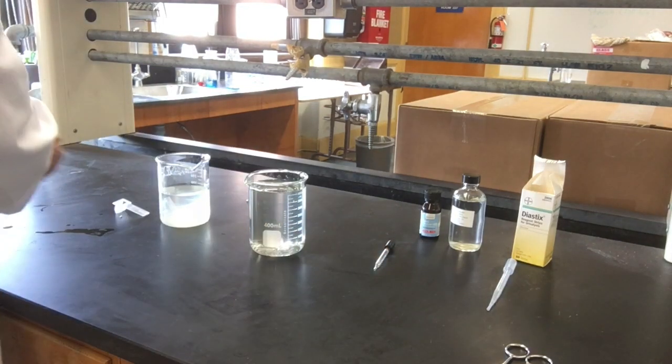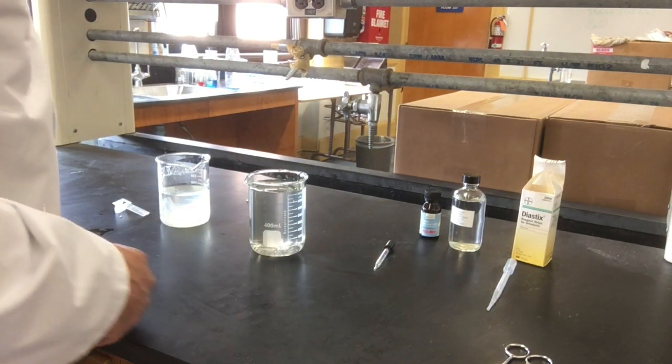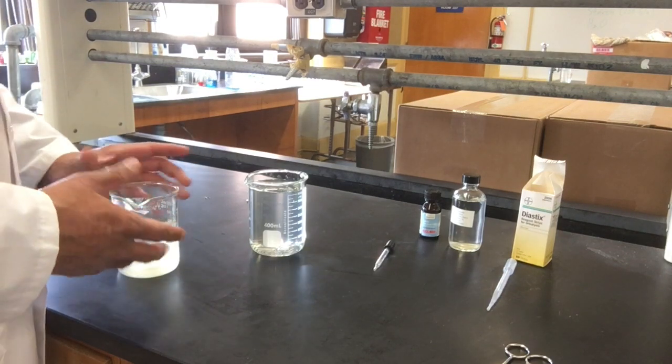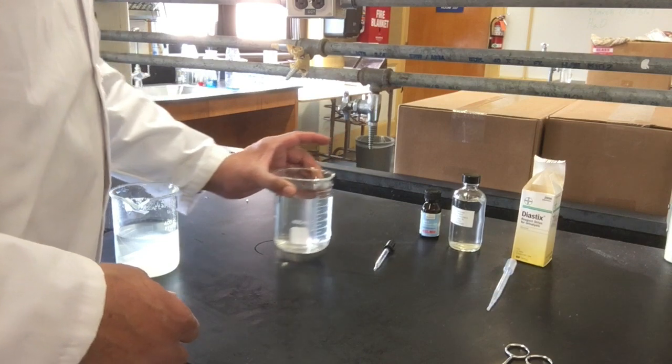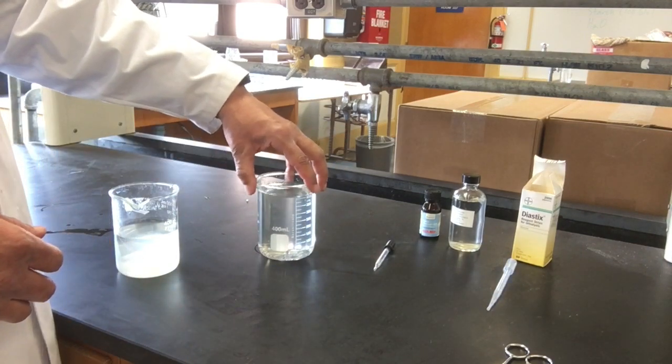Let's start the lab. I have here a beaker with water and dialysis bags in it that I'm going to use for my experiments.